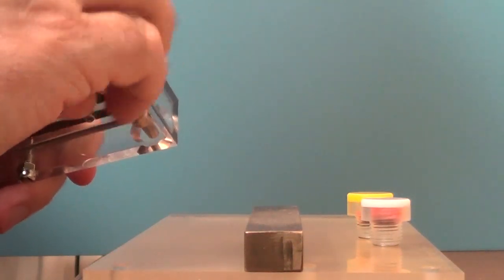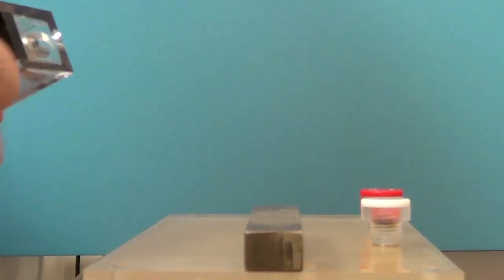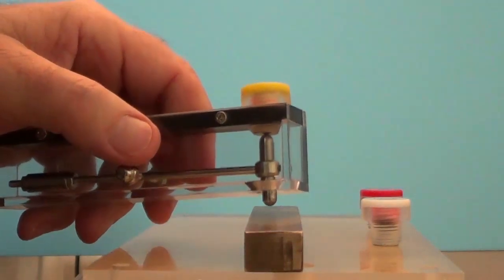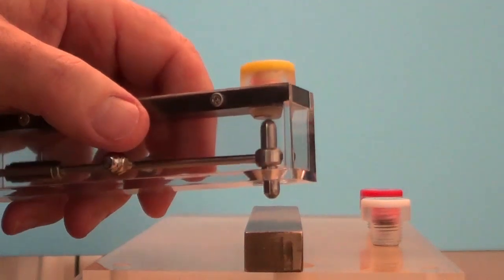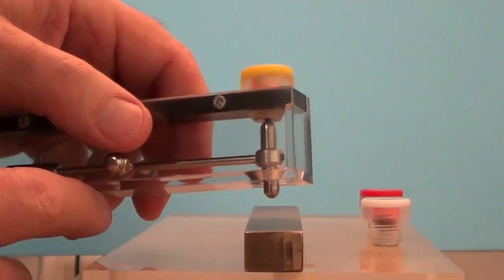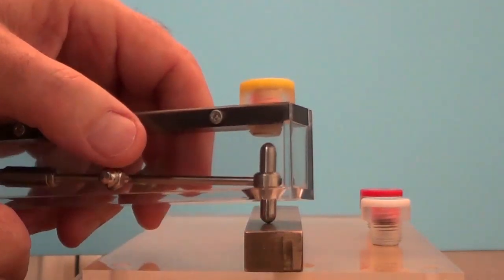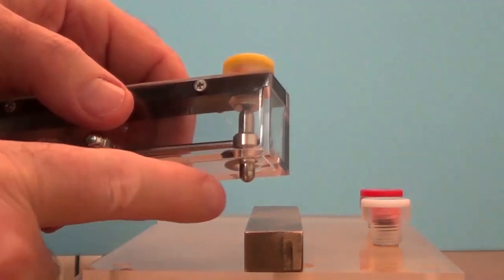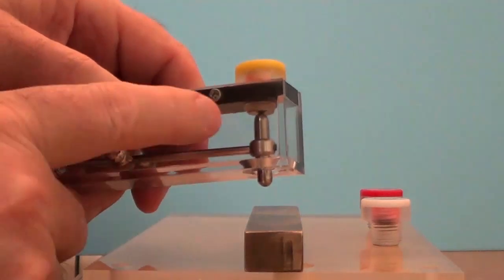Okay, if I switch out to a slightly lower value of insert, the 1.02, that's the next lowest one that I have in this set. Now when I repeat the process what I see is a different reaction. As I put the bottom of the bar magnet in contact with the sample and then pull the indicator away slowly.